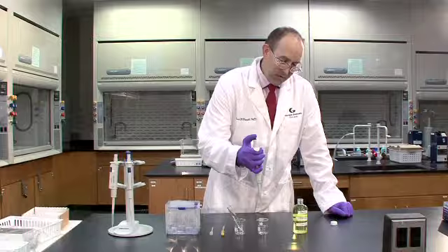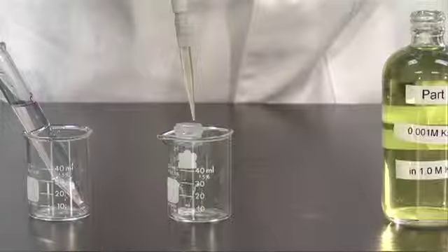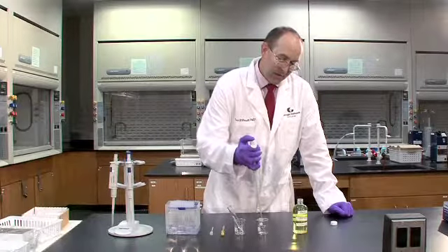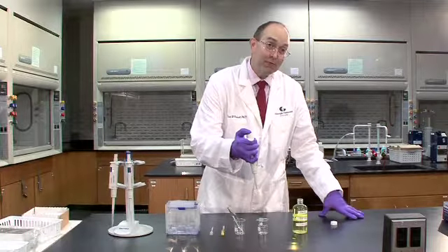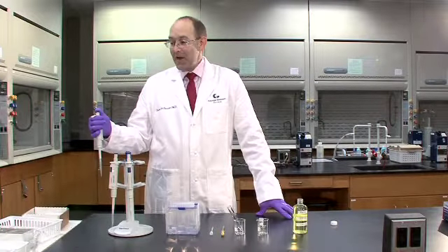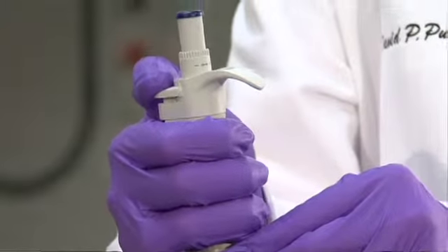So to move the liquid from the ADP into the conical vial, I lower the tip down below the edge of the vial and I slowly push the detent. Once the liquid has been extracted, I move the pipette up. You'll notice that there is one remaining drop in the pipette tip. The pipette tip is calibrated to leave one drop remaining. Don't feel compelled to get that last drop off. I move my pipette tip over to the side and I can extract the pipette tip by pushing the thumb detent.